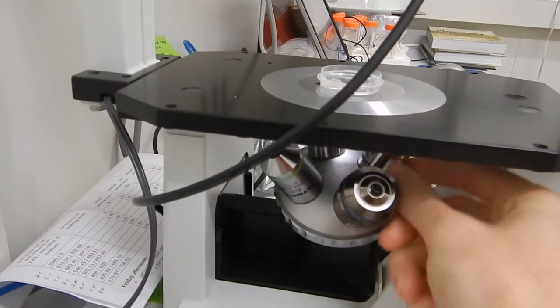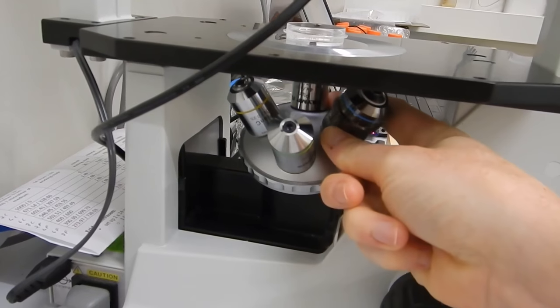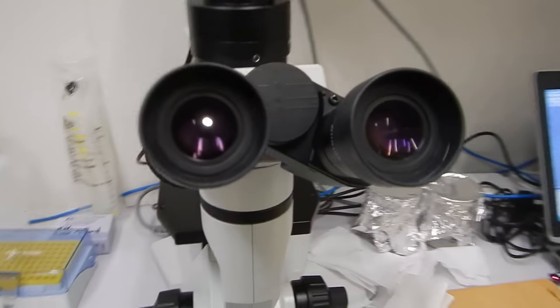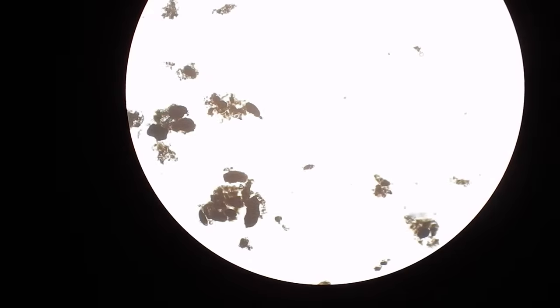Going to our lowest setting. We start with that first to get an overview. Let's have a look and see what we see. Oh, some grains of sand.